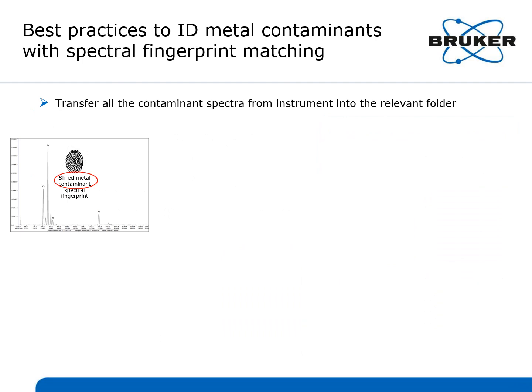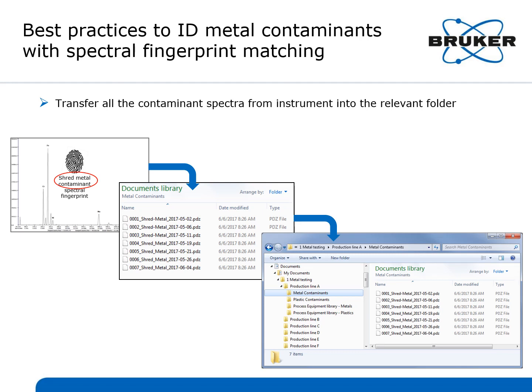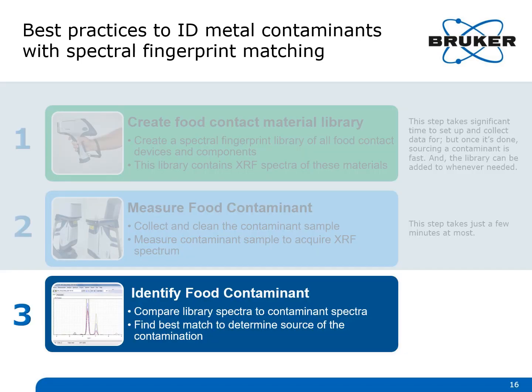Once the data has been collected, you then need to name the contaminant and transfer its spectra to the correct folder in your production line library. If you found it on production line A, you would then save it to that line's metal contaminants folder. The final stage in using spectral fingerprint matching is to compare the spectral fingerprint of the metal contaminant to the spectral fingerprints of all the metal equipment in the production line folder.